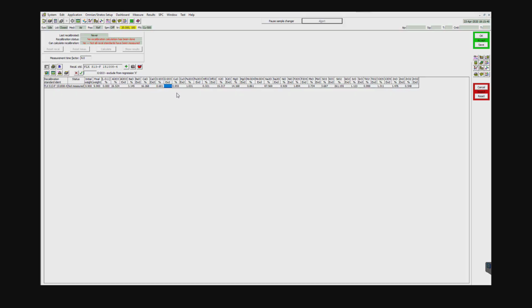I'm going to use everything there, and now that I have it in here, I'm going to go ahead and simply measure it. So I'm going to go to this measure the selected recalibration standard. Before I do so, let me give it a quick save.